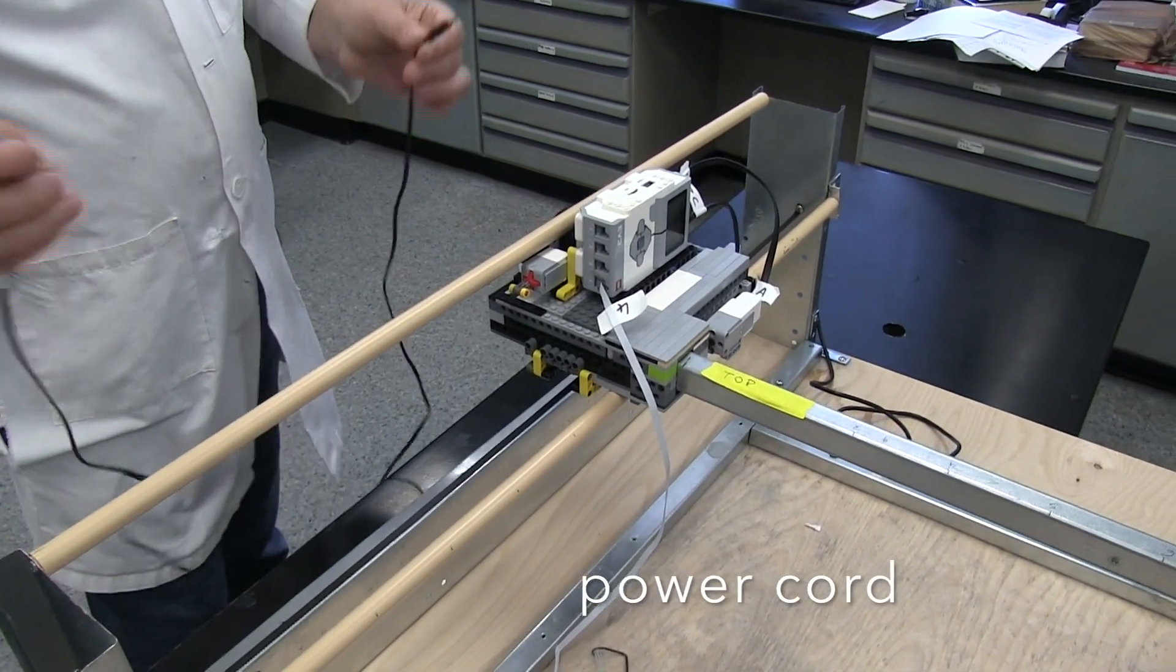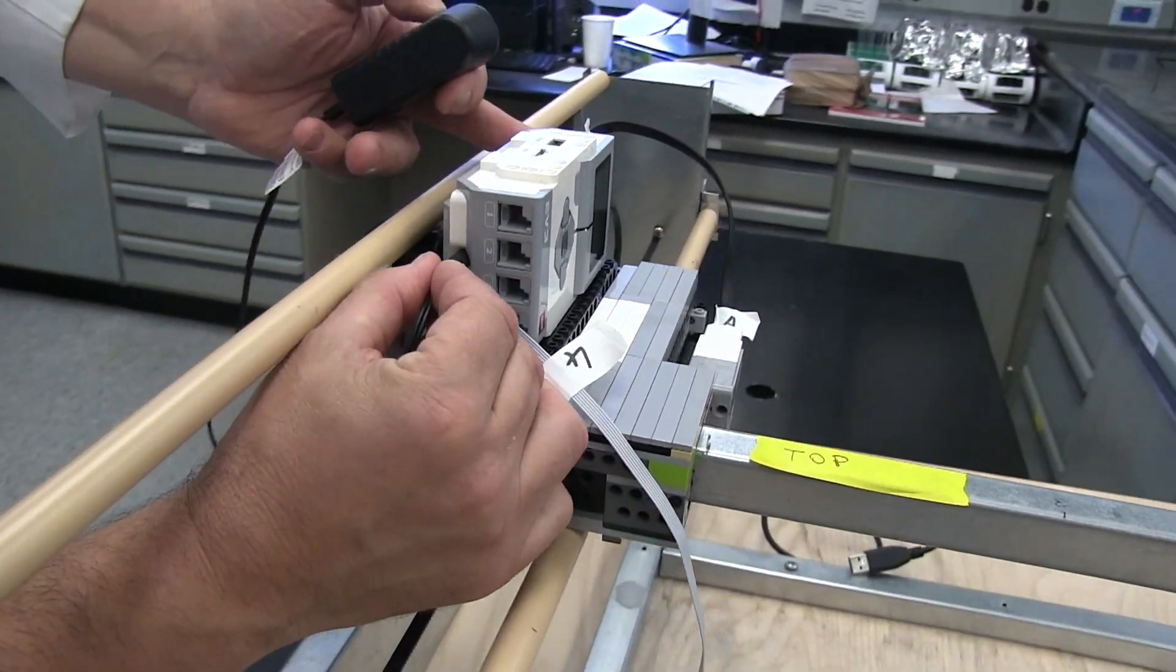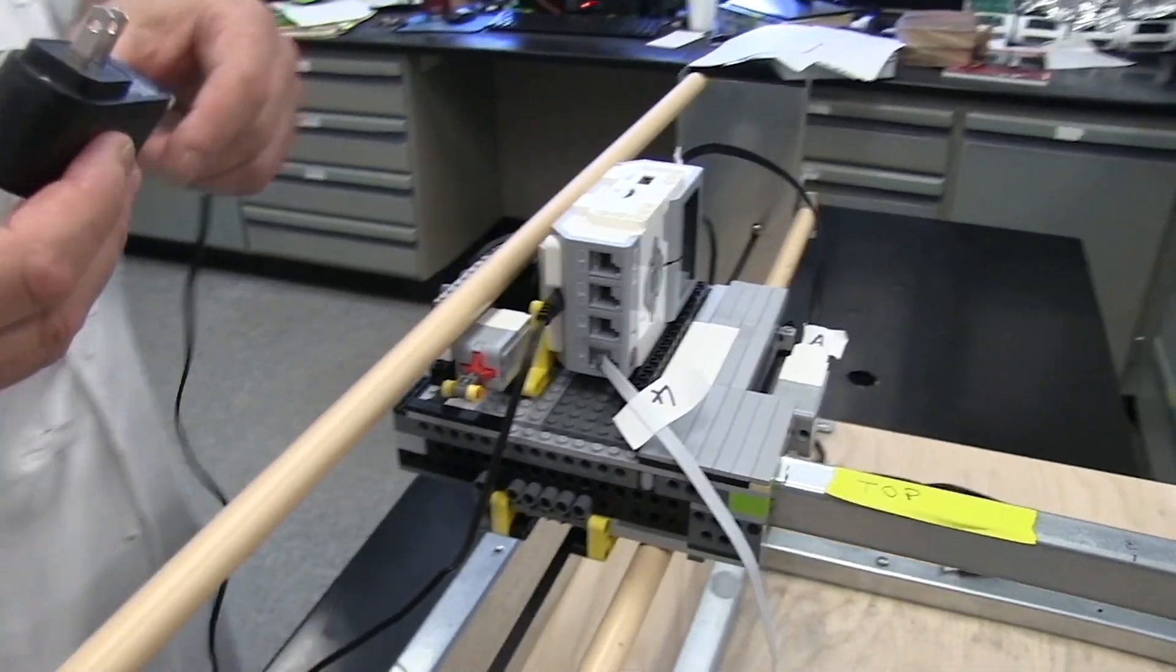While the unit can run on battery power, we prefer to leave it plugged in to ensure that none of the HPLC runs are disrupted.